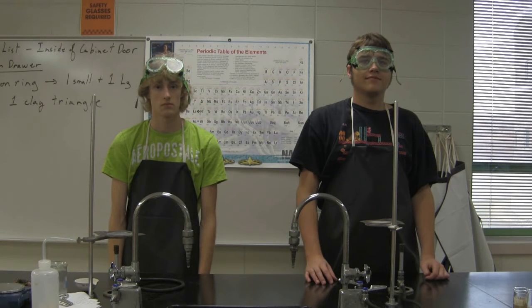These are lab experts Dexter and Sean, and they're about to teach you the basics of using the Bunsen burner.